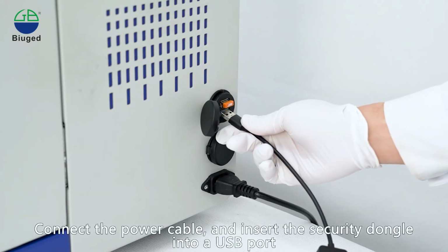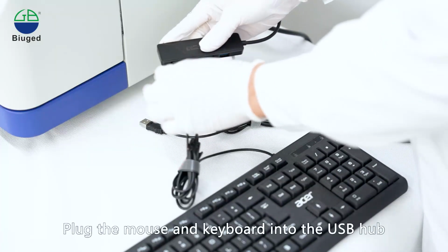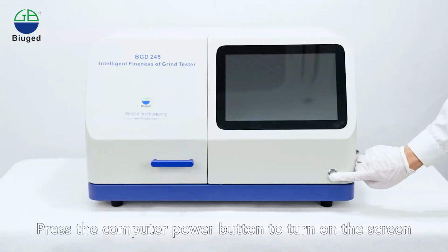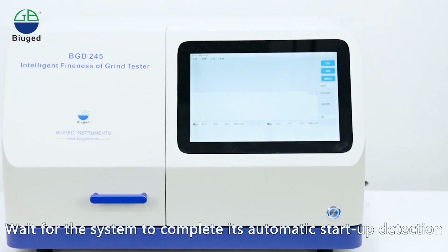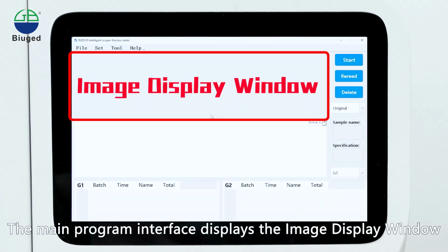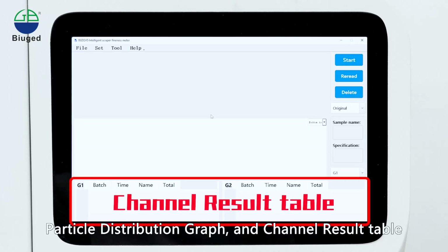Insert the USB hub into a USB port. Plug the mouse and keyboard into the USB hub. Press the computer power button to turn on the screen. Wait for the system to complete its automatic startup detection. The main program interface displays the image display window, particle distribution graph, and channel result table.